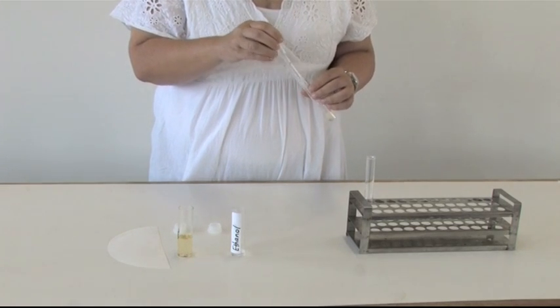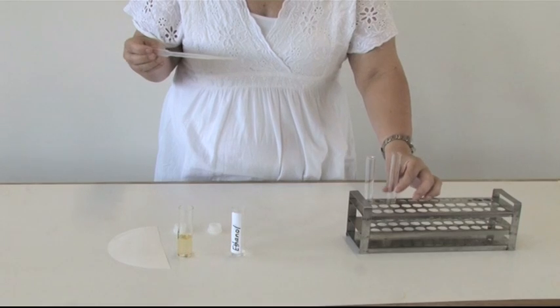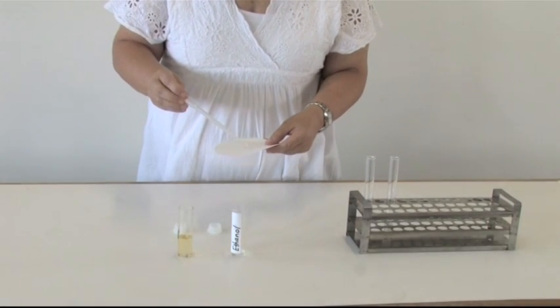Using a dropper, place one drop of the oil-ethanol mixture onto filter paper. Allow the filter paper to dry.